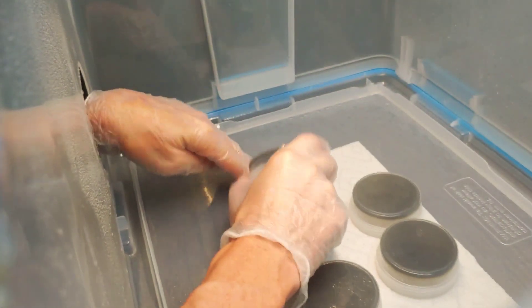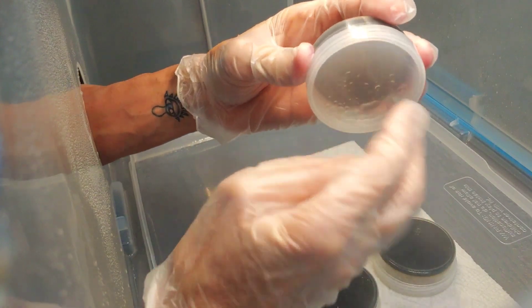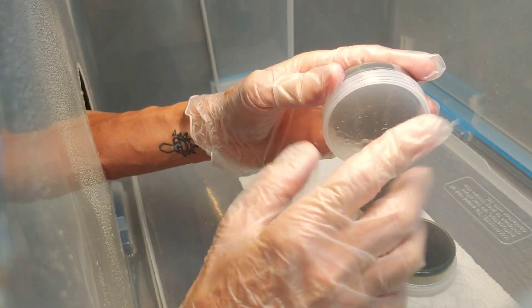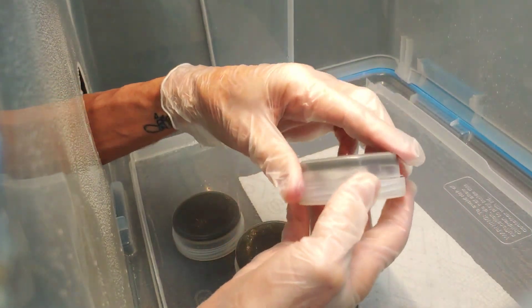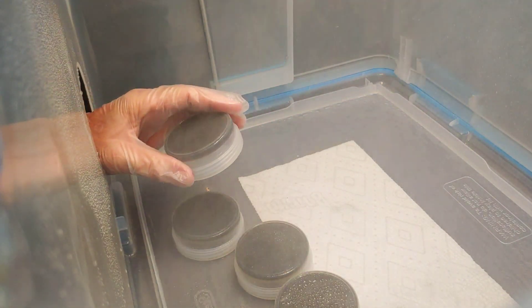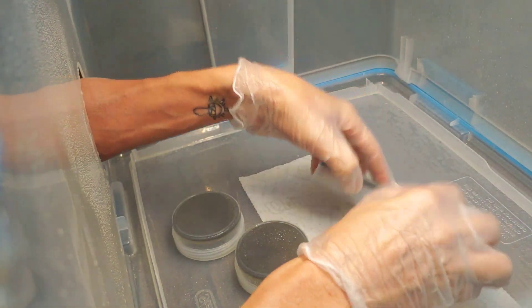This is one of the bottom ones that has a lot of condensation and it tends to stick no matter how much shaking I do. They still work — they're okay. I'm not going to clean that with a paper towel or alcohol because that would most certainly contaminate them. I'm already risking it a little bit by opening them and shaking them, but even with that I have very good results as you've seen in my videos.